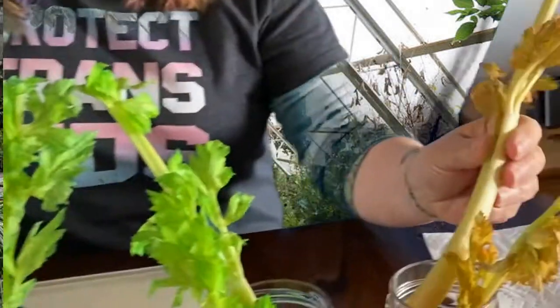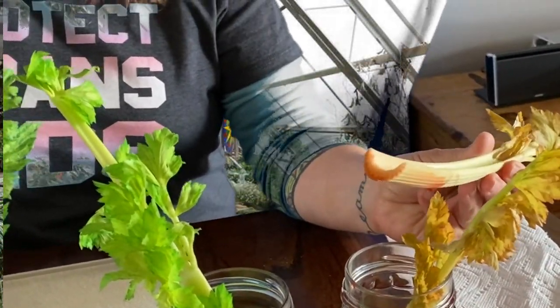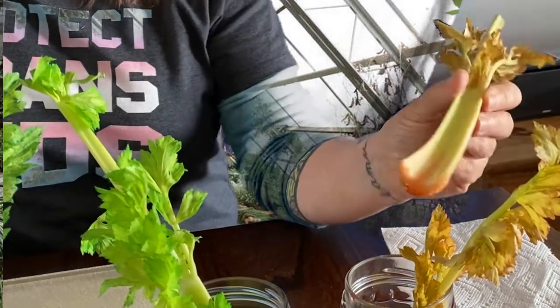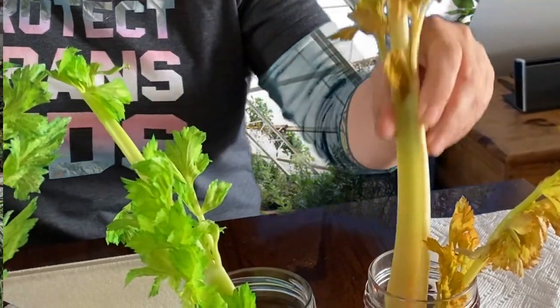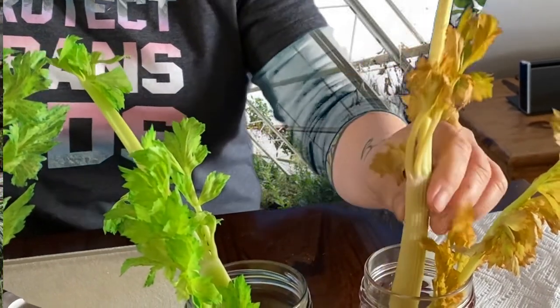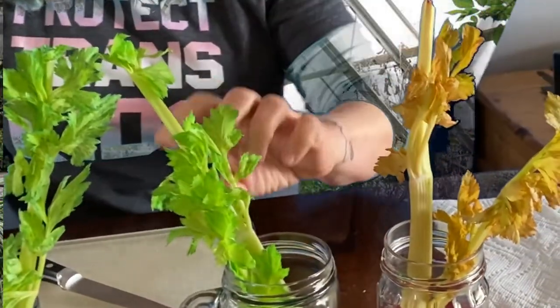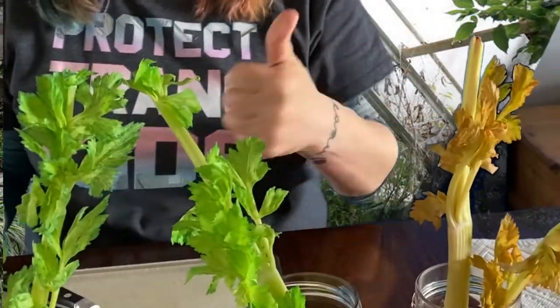When we look at these in the microscopes, we're looking for the xylem to be the color of whatever water it was in, because it's been stained as the water moves up through it. We should be able to see the same thing in the leaves. The easiest one to see is probably going to be the red, so that's the one I'm going to start with.